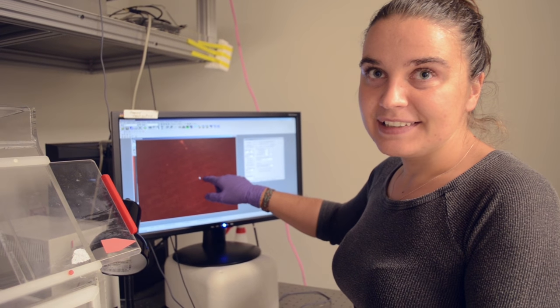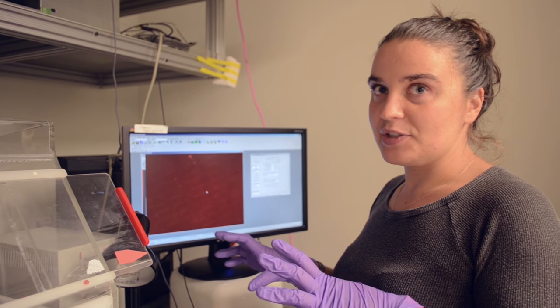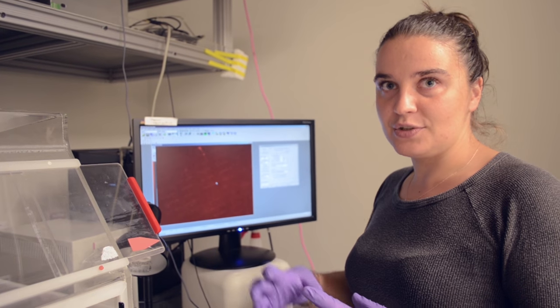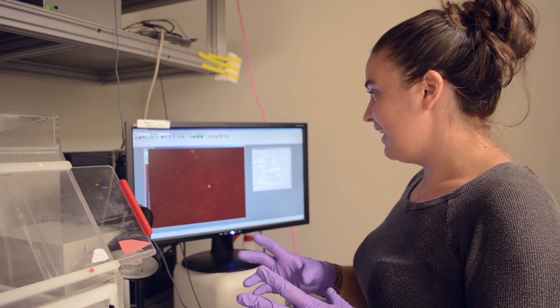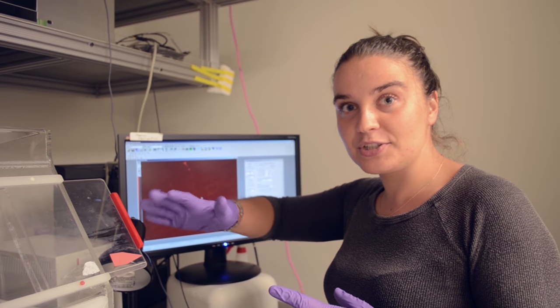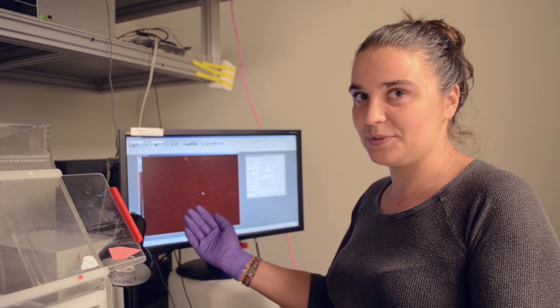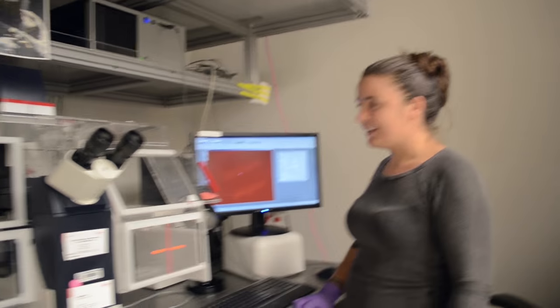Yeah, so we'll be watching these beads move, and you might be saying, well, I can't resolve each single bead. Right. But that's not actually what we care about. We want to look at textures. We're going to use a computer program that will look at the texture here and match it to another image and try to follow that texture. It's almost like animal fur or something, where there's a very random pattern to it, so that you can say, yes, this is this particular area, because this other area doesn't have this one strand going this way. So that's what we're doing. Cool. Yay, awesome. It worked.